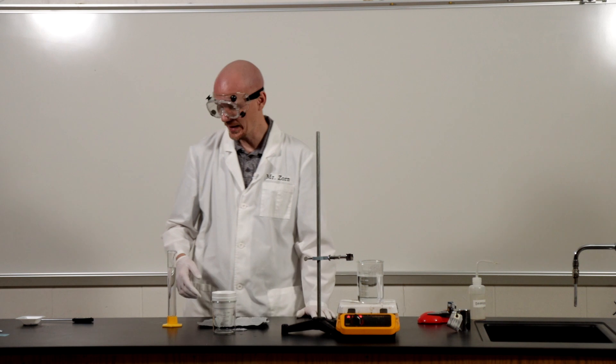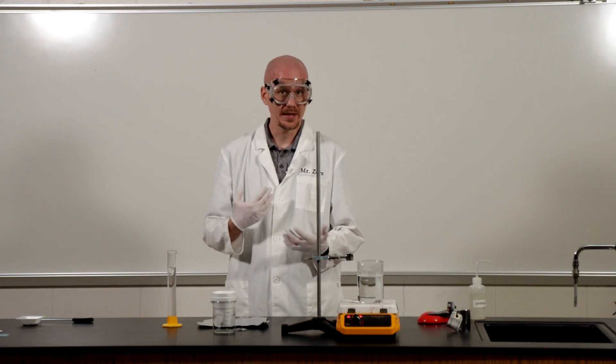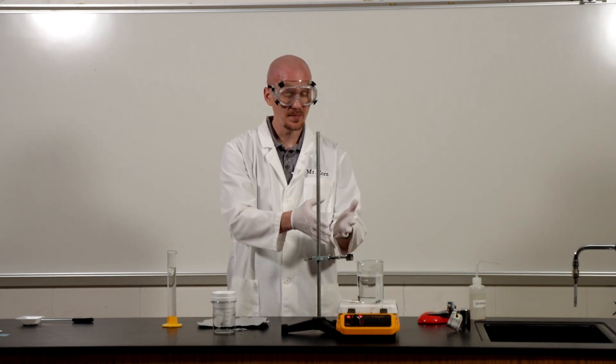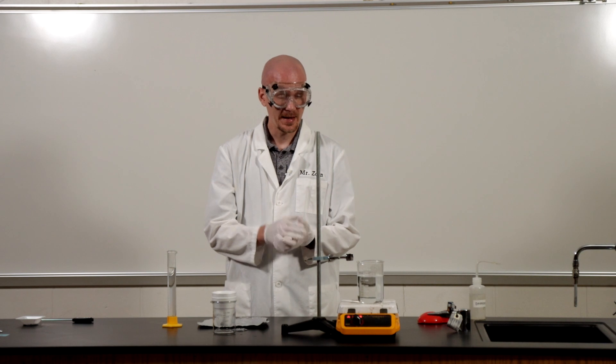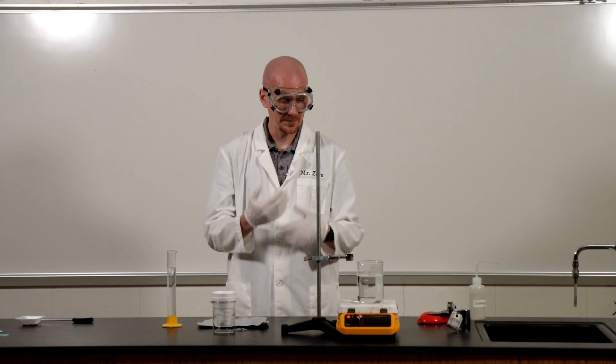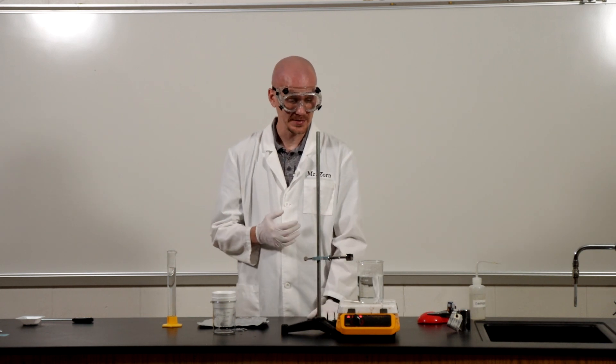Now if you notice off to the side, I've got this giant beaker of water that's being heated up. Well, I'm going to put my metal sample in there and I'm going to get the temperature of that metal sample after a couple minutes after it's had a chance to heat up.